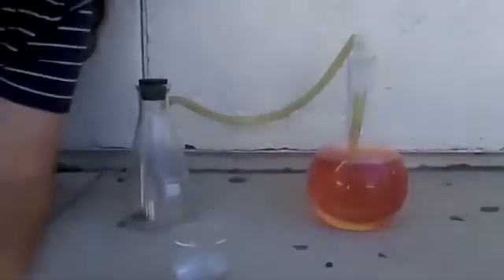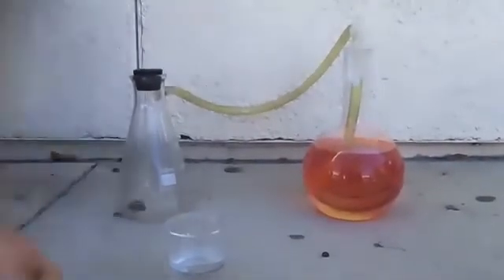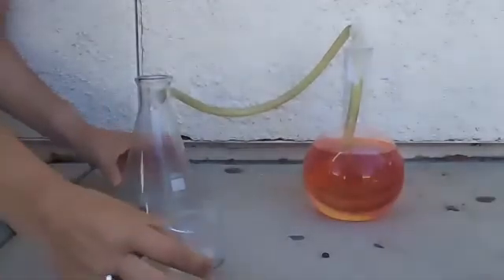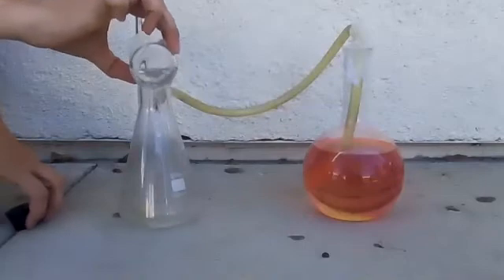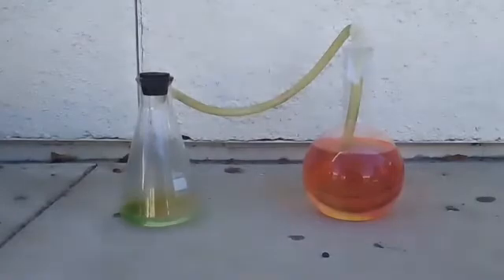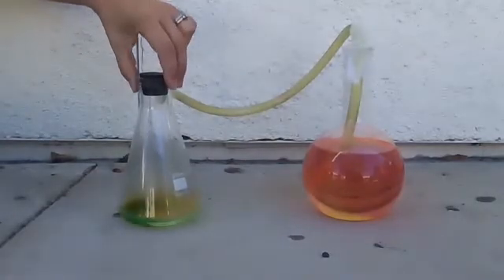Okay, so I'm going to take the cork off, take my nitric acid very carefully, and pour it in and cork it so the gases produced don't escape.